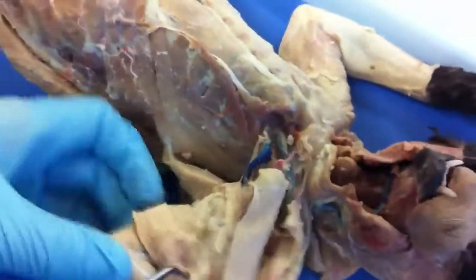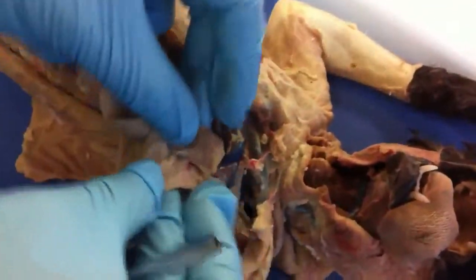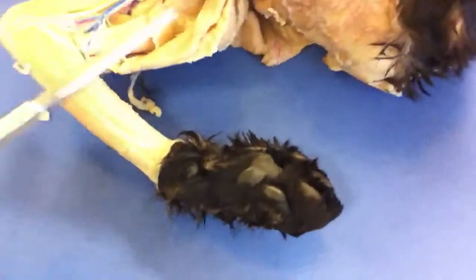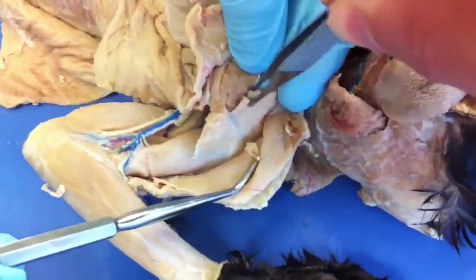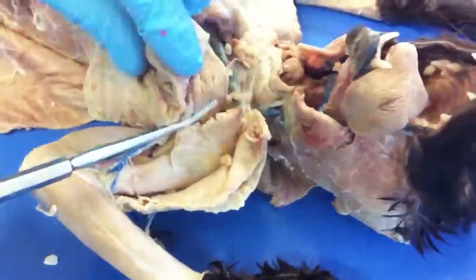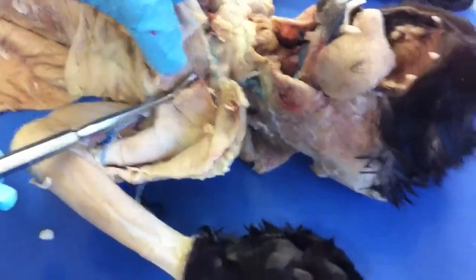The subscapularis is basically the layer of muscle just deep to the pectoralis major. We cut it, but it actually inserts right here. That is the subscapularis, directly underneath the pectoralis major.